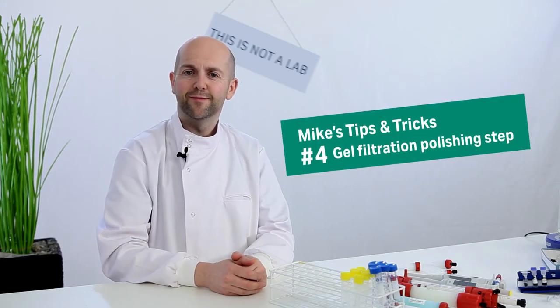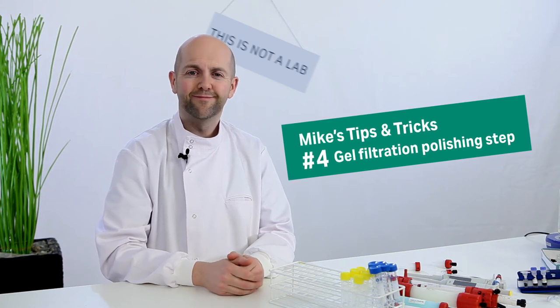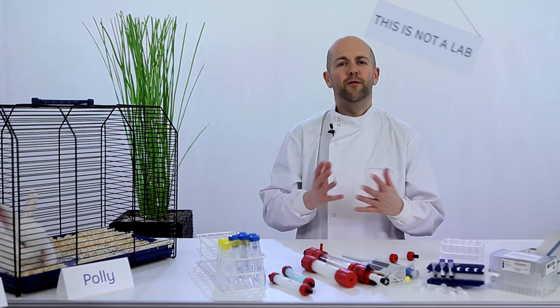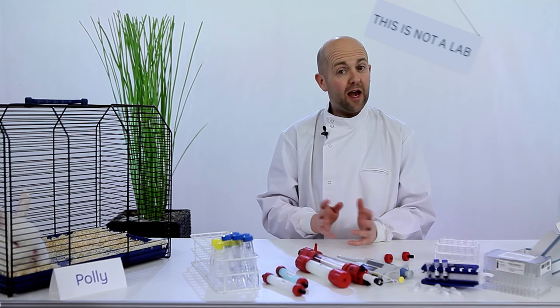Tip number four: when to use a gel filtration step to get optimal homogeneity. One-step purification with Protein A or G usually gives high purity antibody. To improve homogeneity, you should think about using a gel filtration polishing step, for example with a Superdex 200 column. This is really useful for separating monomers from dimers and removing large aggregates.